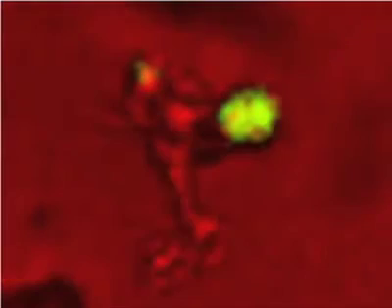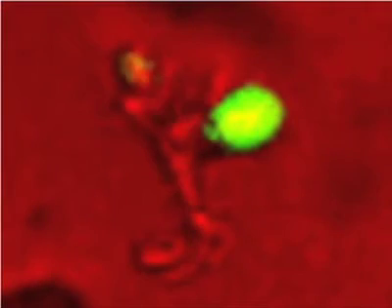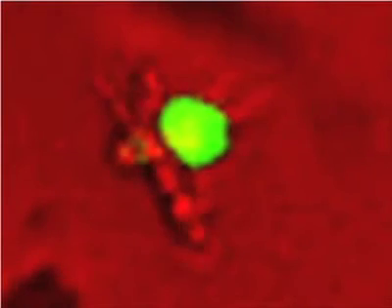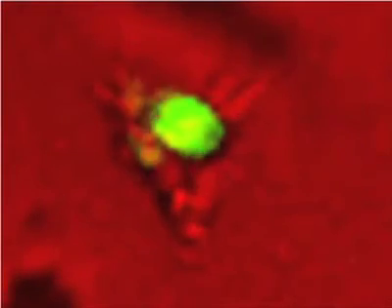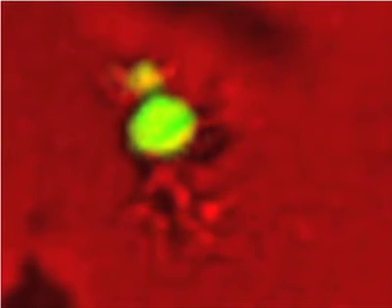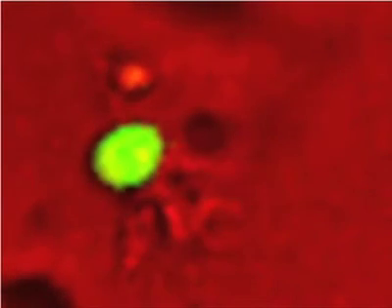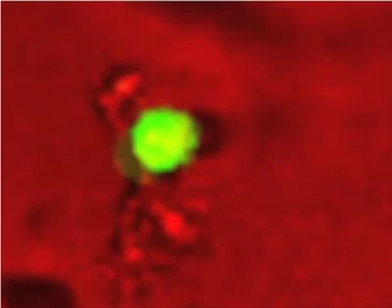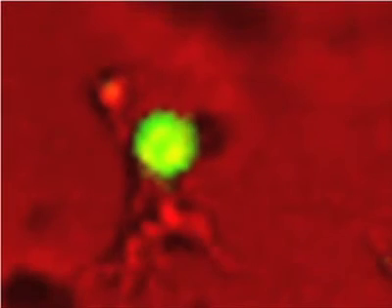As the T cell contacts the surface of the dendritic cell, we can see it suddenly fluoresce bright green as it becomes activated. However, it still continues to move, crawling over the surface of the dendritic cell, perhaps to sample the cell's display of peptide-MHC complexes.